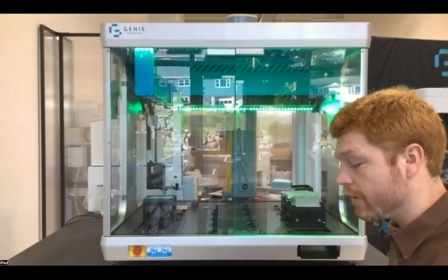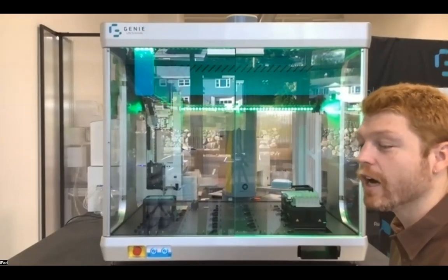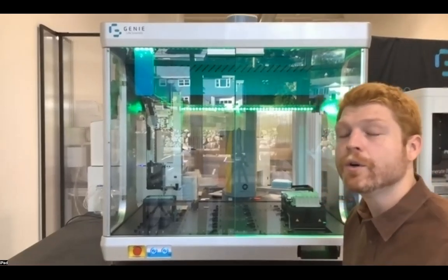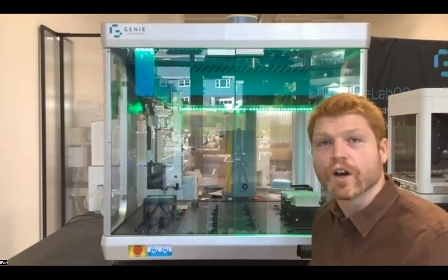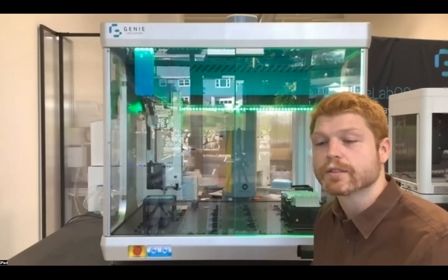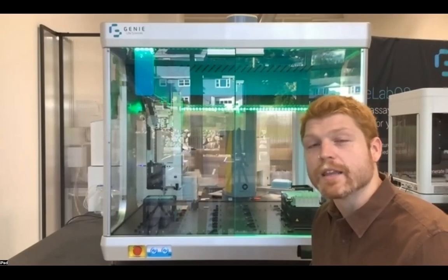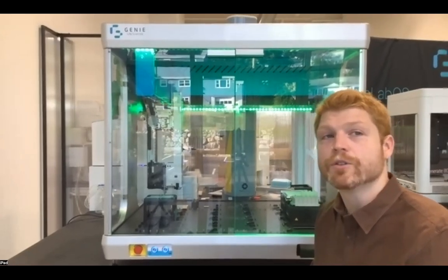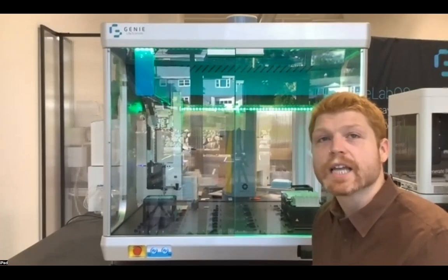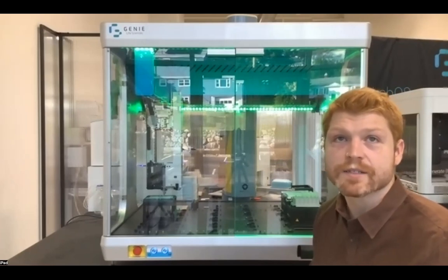Now to step even further into the power of our cloud-based software, say that you have the need to create a workflow with instrumentation that does not currently exist within our space. You have the ability in the background to code your own Python plugins, which can then be utilized as drag and drop commands to be handed over to your end scientists.